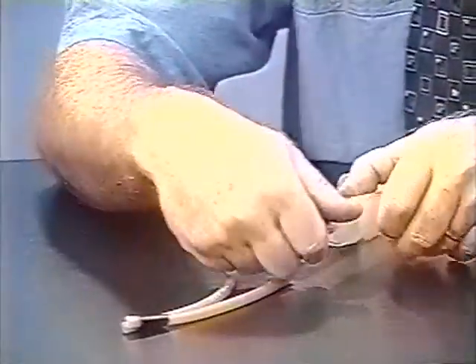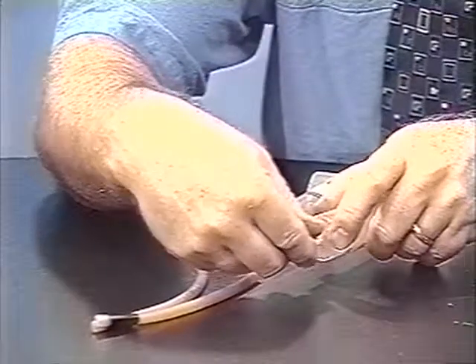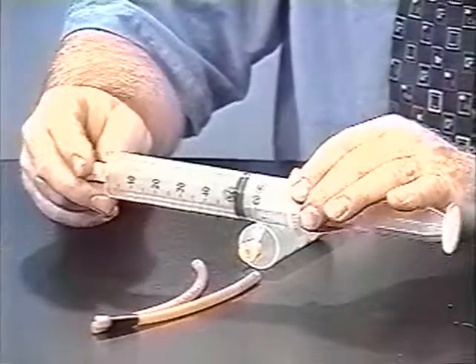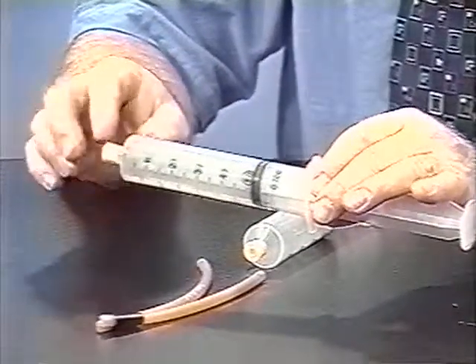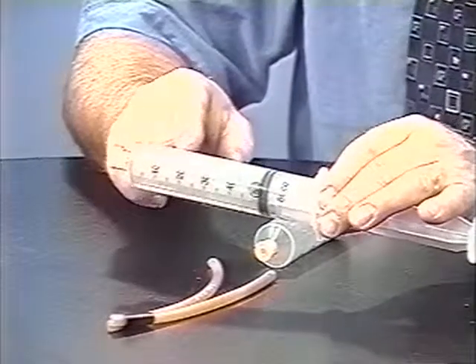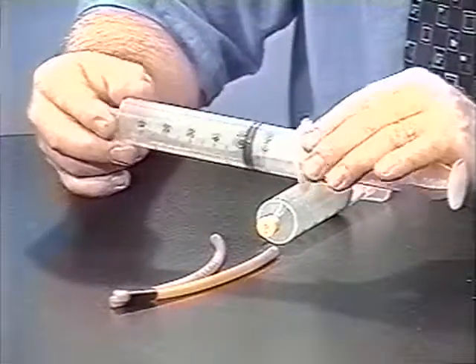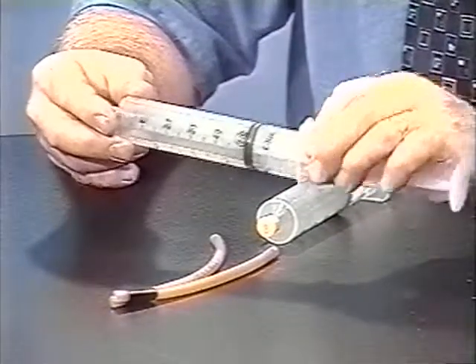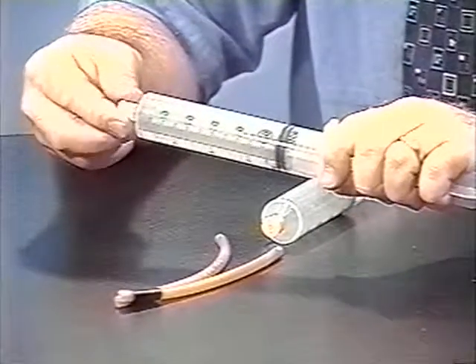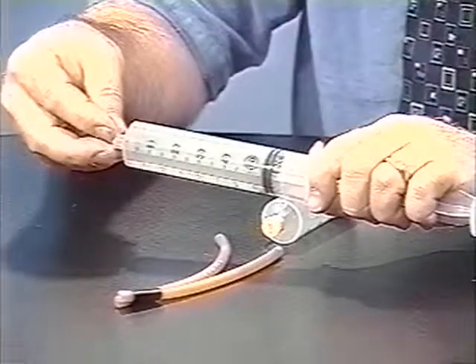Then I can connect one of them up to chlorine. And let's learn another interesting technique while we're at it. In order to not let any of the chlorine out into the room, which would smell awful, I'm going to simply pull the plunger back by a couple of milliliters. And then we're under slightly reduced pressure in here, so now I can take off the cap.